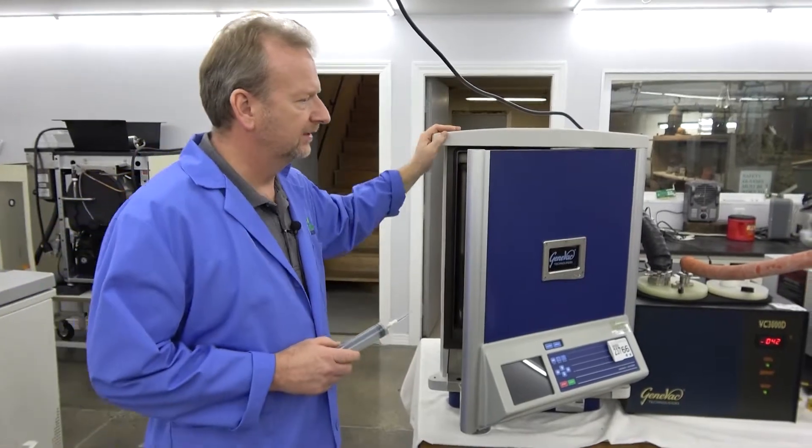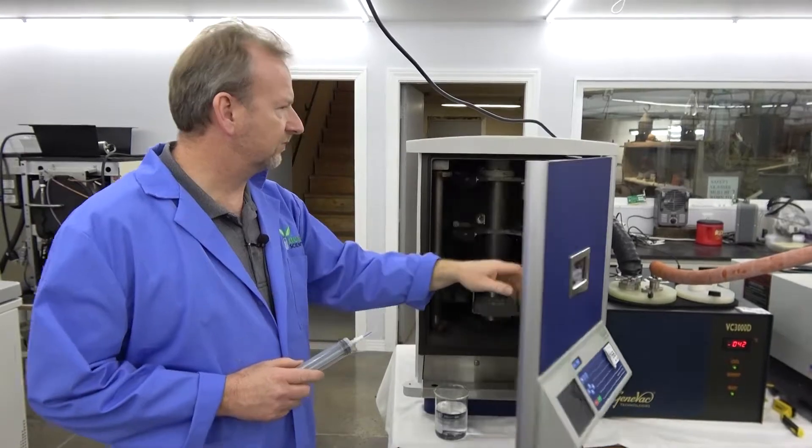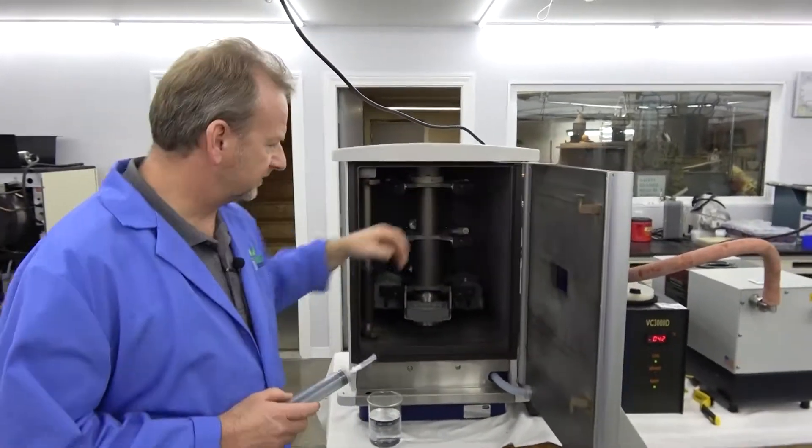It's been running here for about 15, 20 minutes now, so everything's pretty much ready. So we're just going to go ahead and put some water in.